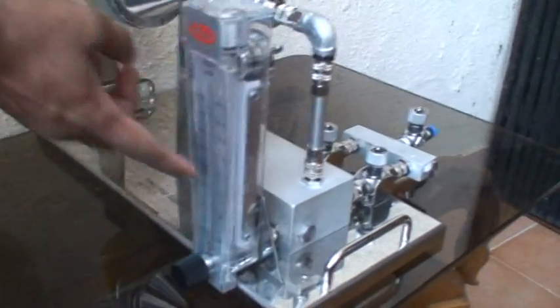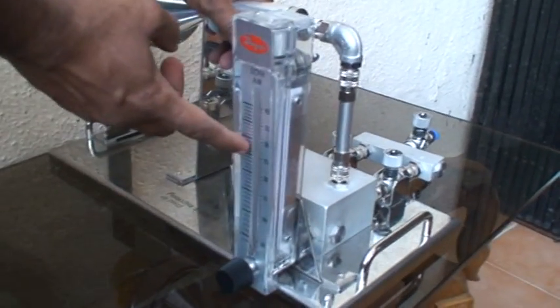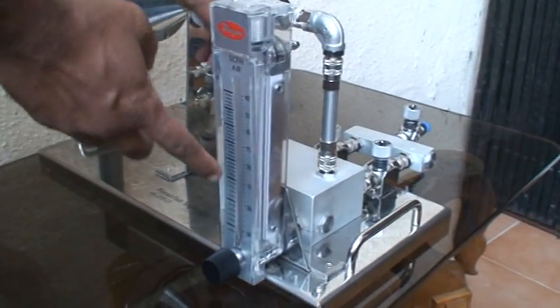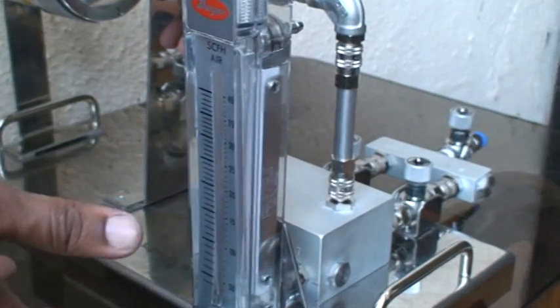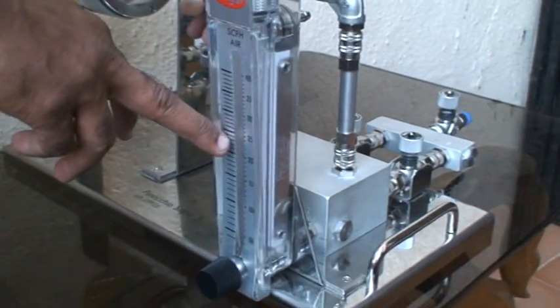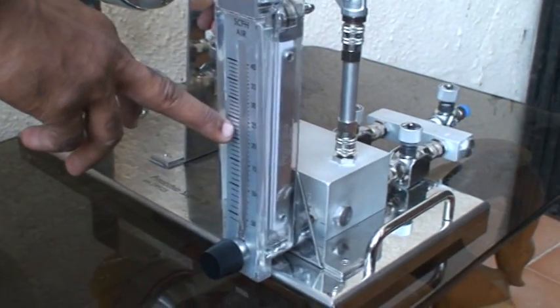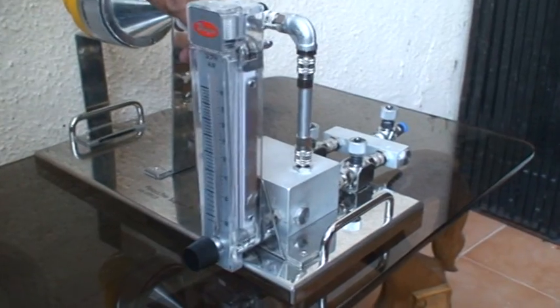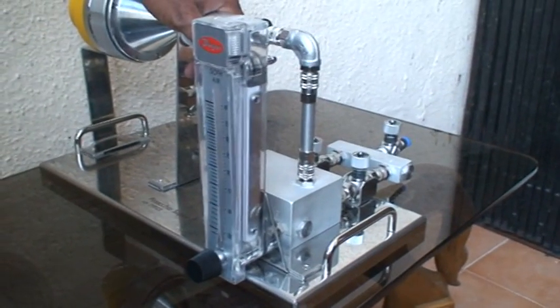The rotameter displays in SCFH because this is an Italy-made instrument. You can use a local make or this one. In this unit, you set it at 210 SCFH, which is equivalent to 100 liters per minute.